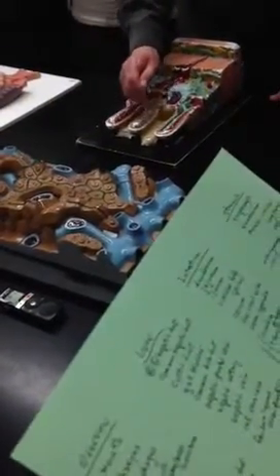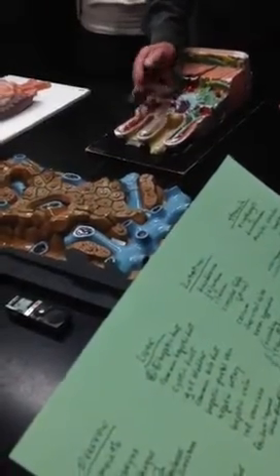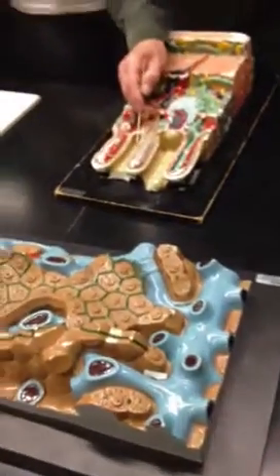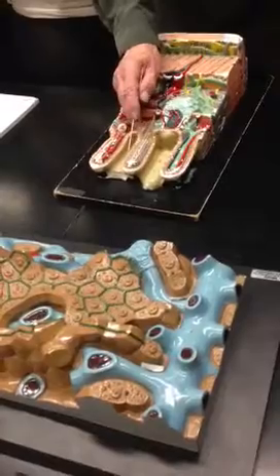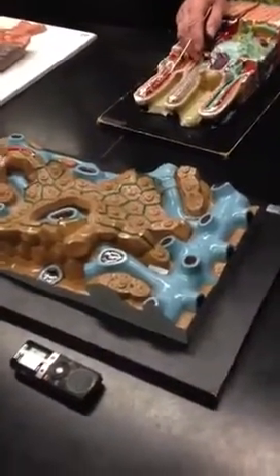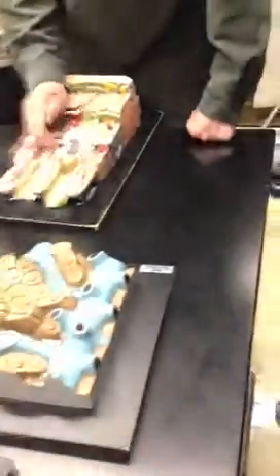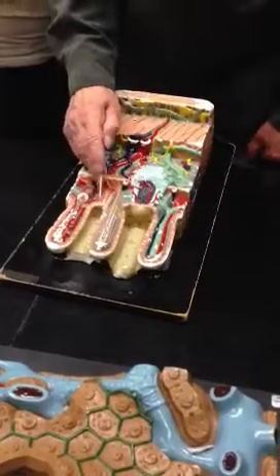We can see that the villi are lined by these columnar epithelial cells, and the little blue jobs amongst them are known as mucus glands. They have another name too. What name do I have over there? Paneth? Not Paneth. Goblet? Goblet. Of course, under the microscope, they kind of look like a wine glass. So they're called goblet cells. Okay, so these blue jobs, if I label the blue thing over here, you've got to tell me goblet cell or mucus gland cell. Okay?